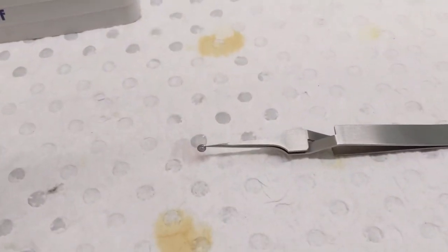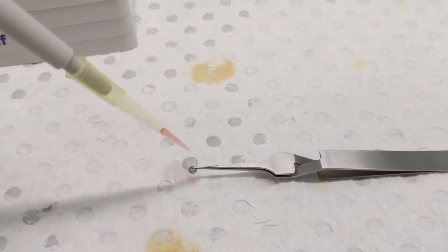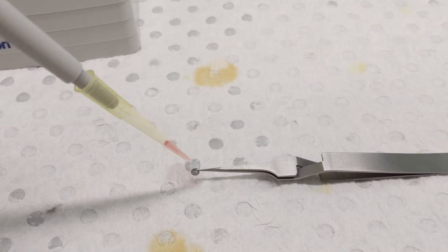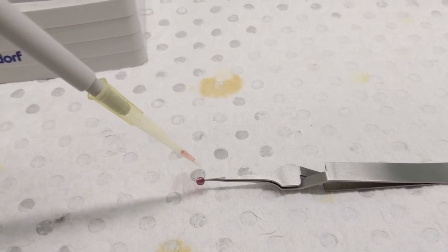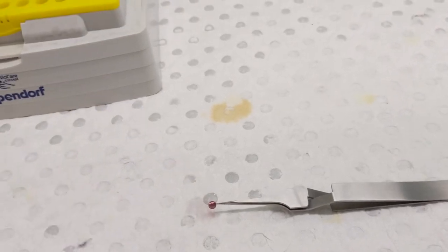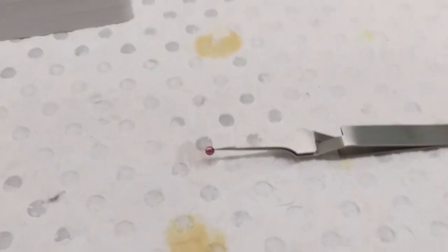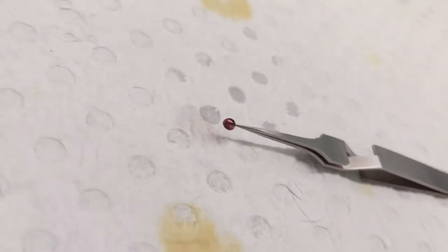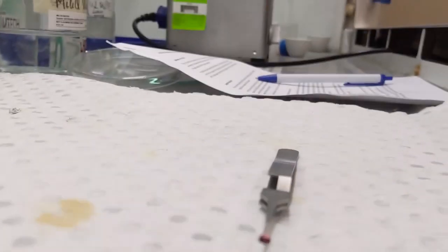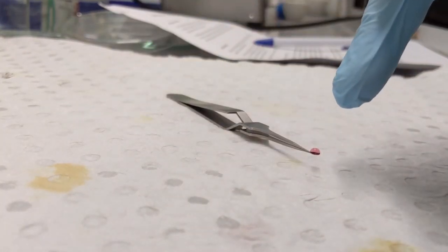I'm now going to drop cast this onto the TEM grid. As you can see, I have the TEM grid here, supported by the tweezers, and we're going to drop the solution onto this. So that was a little bit less than 20 microliters. Now we have the sample on the TEM grid, and if I get that into focus, you should be able to see the droplet formed.